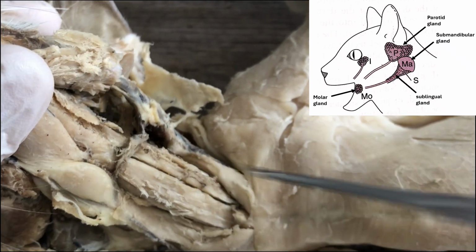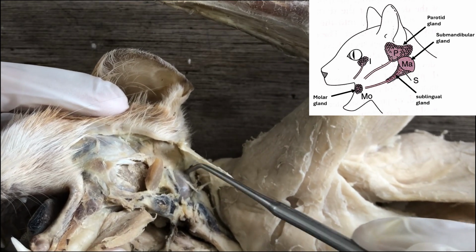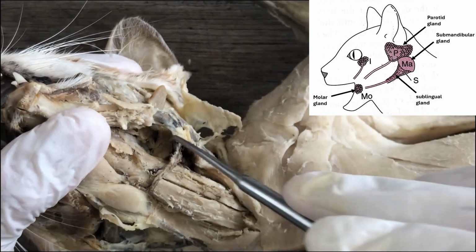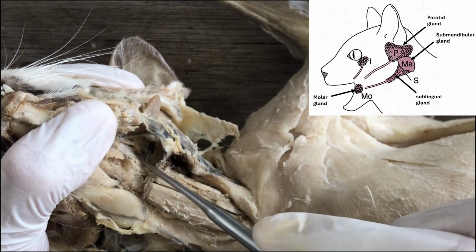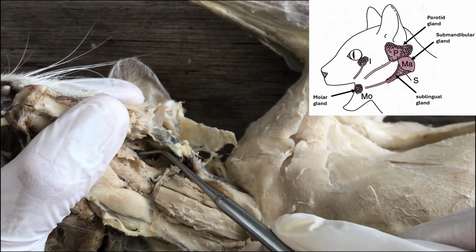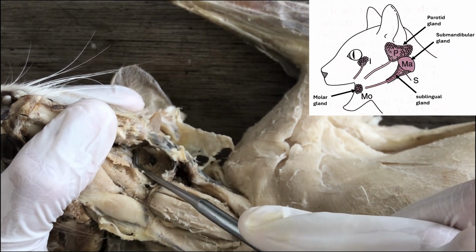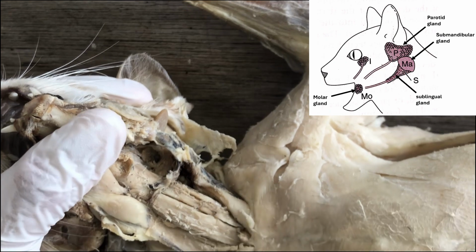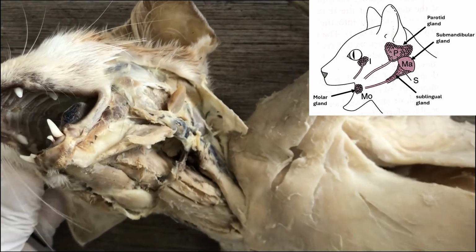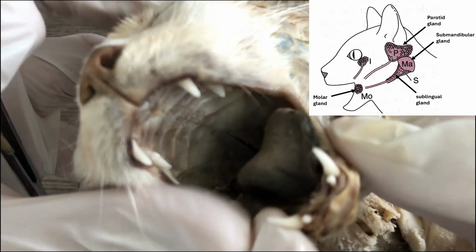This is the sublingual. And they actually share a duct. So the submandibular gland will secrete saliva in order to help with carbohydrate digestion to its duct. And then that duct will also receive the secretions of the sublingual salivary gland. And so this is the duct, that white line. So that duct will receive both the secretions of the submandibular and sublingual, and will empty into the mouth near the base of the tongue. So this is the tongue.